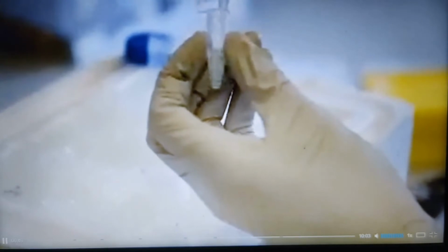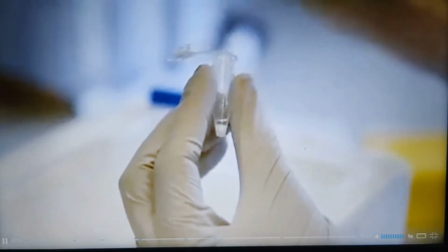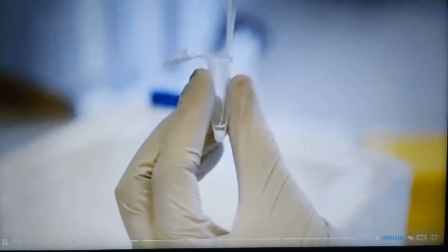To prevent damage to the streptavidin beads, remove the end from a pipette tip. Gently resuspend the beads and remove an aliquot to a siliconized tube. Wash the streptavidin beads with lysis buffer, clarifying by low-speed centrifugation after each wash. After each wash, carefully remove the buffer. Streptavidin beads are very small and can be easily displaced, even when using fine bore pipette tips.